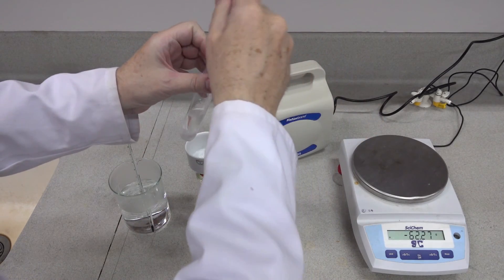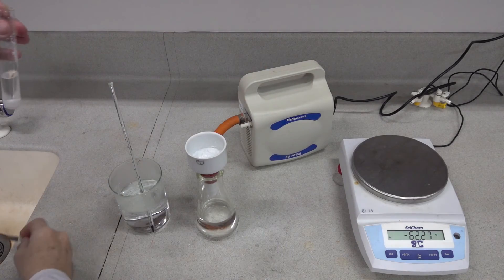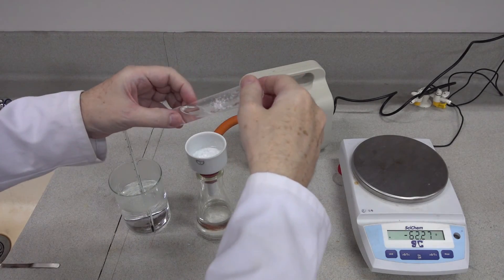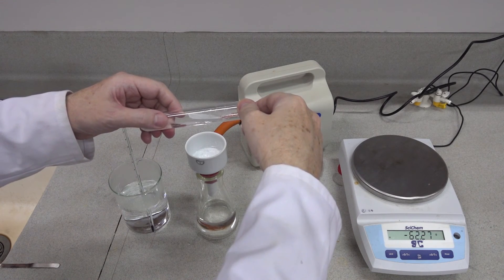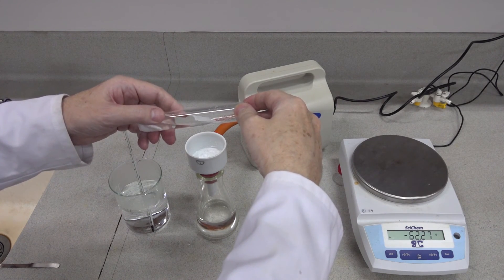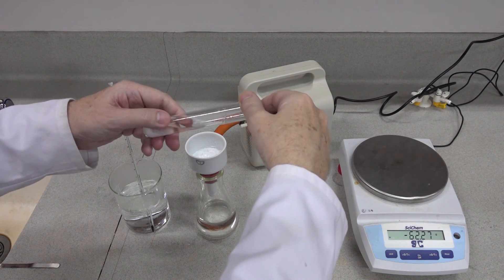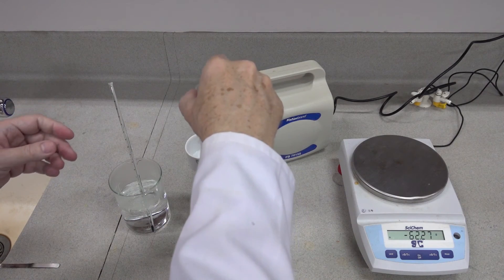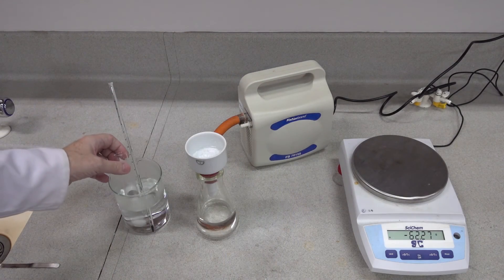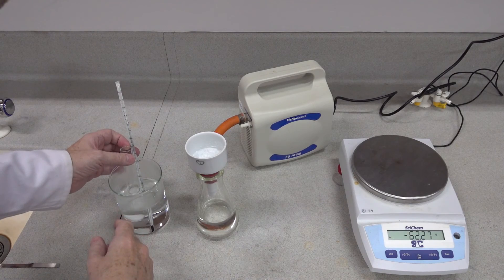Just push down a little bit there — we need to tilt the tube slightly. Be careful not to spill any of the ethanol; we won't get it all into solution but we will get most of it. Then that needs to go into the hot water bath — it's still just below 79 degrees.